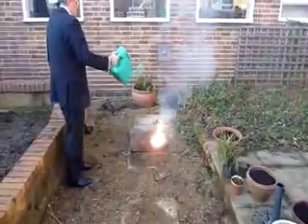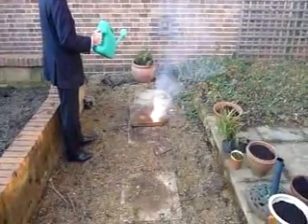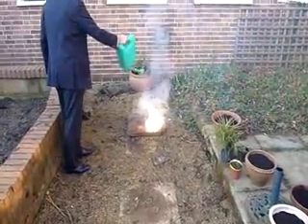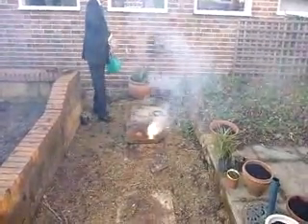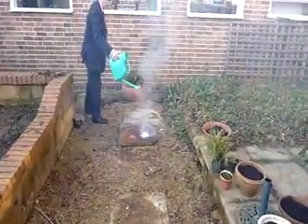I'm getting such good pictures. It's snowing! If we keep going, eventually we'll react and then we will be able to put it out with the water. Now that's a jet of hydrogen coming off. So when flames are jetting out, it's producing hydrogen from the water, and the hydrogen is burning.